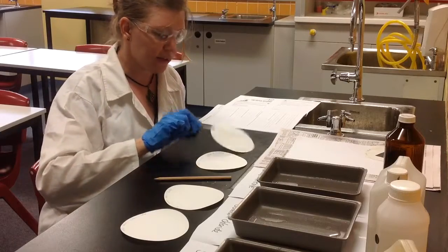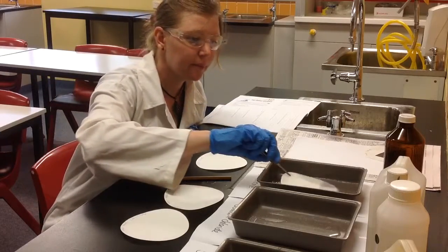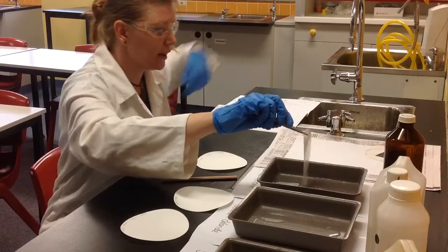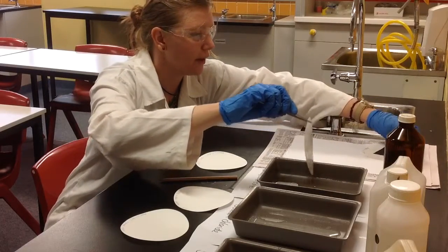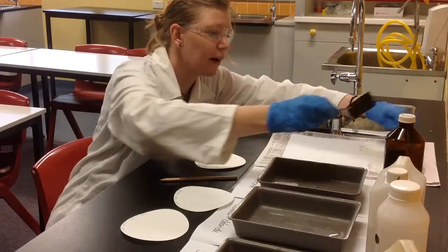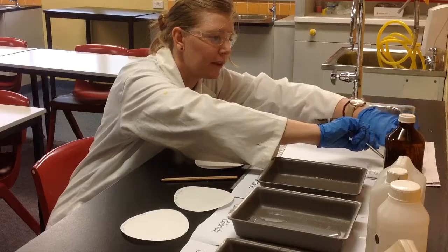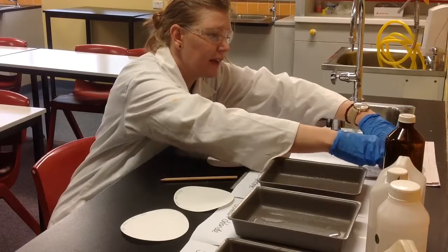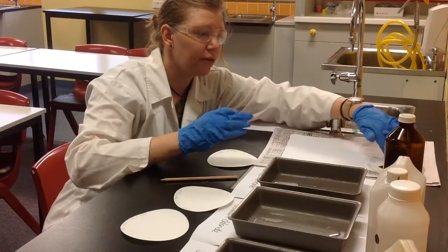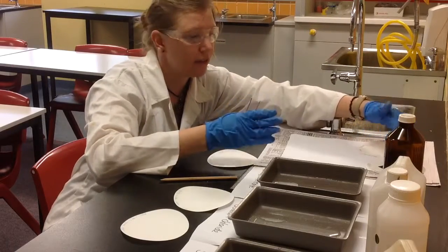The first thing we're going to do is stick it in some silver nitrate. Make sure it's all covered, and then put it on our paper here — it's what I did earlier. Now we're going to cover up part of the paper with a piece of cardboard to take away the light, and you're going to see the effect of the light-exposed area compared to the covered dark area.